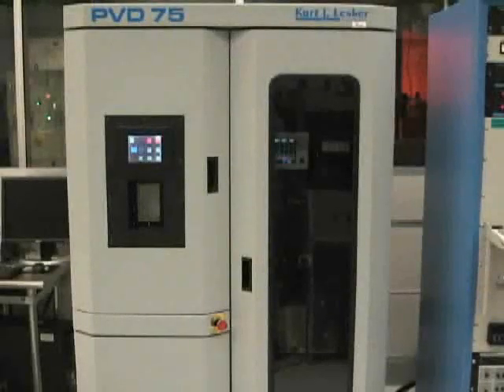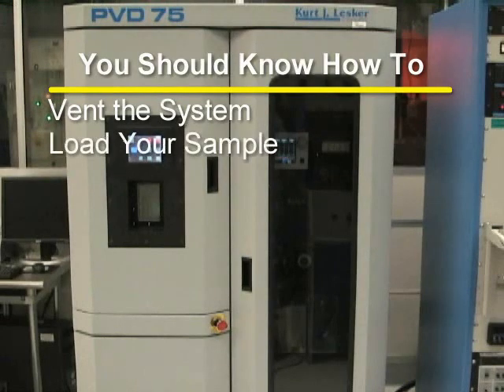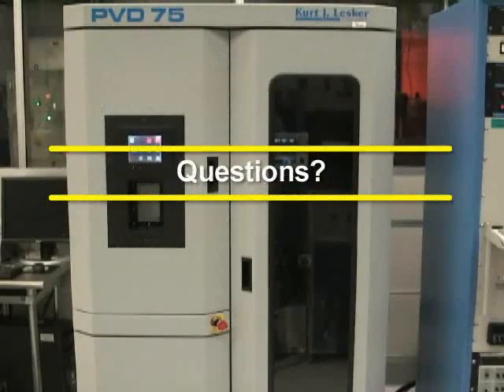You should now have a pretty good understanding of how to properly use the PVD75 Filament Evaporator. You should be able to vent the system, load your sample, pump the system down, set up the deposition, and perform the evaporation. If you have any questions, please direct them to an MIRC staff member.